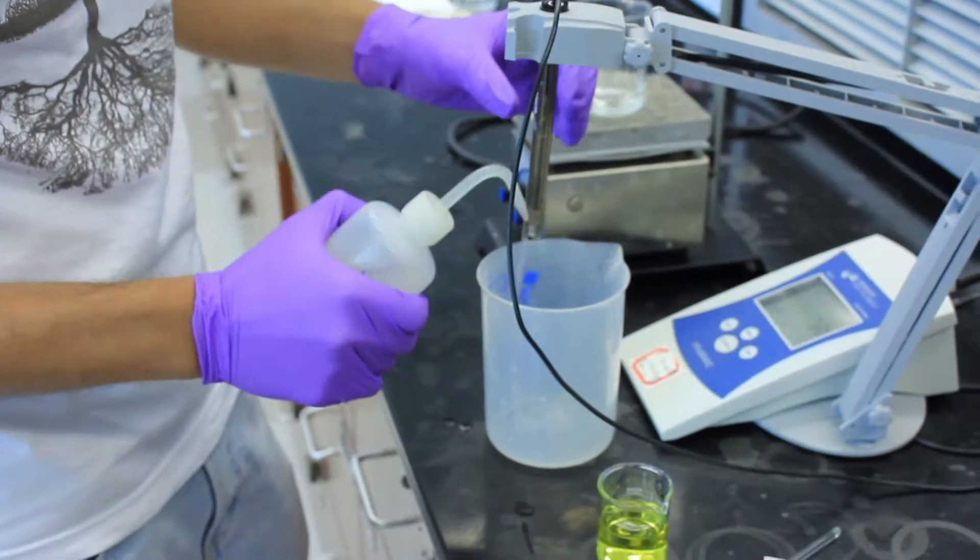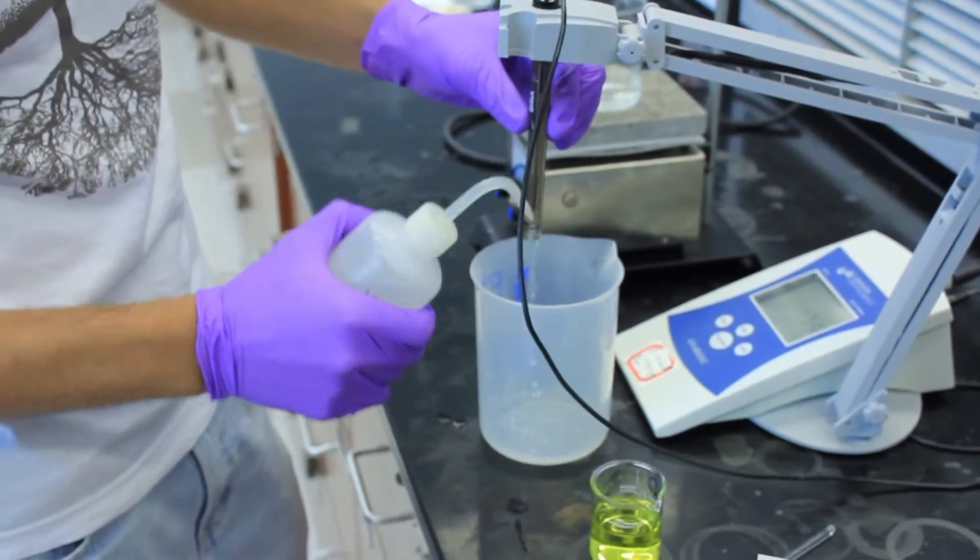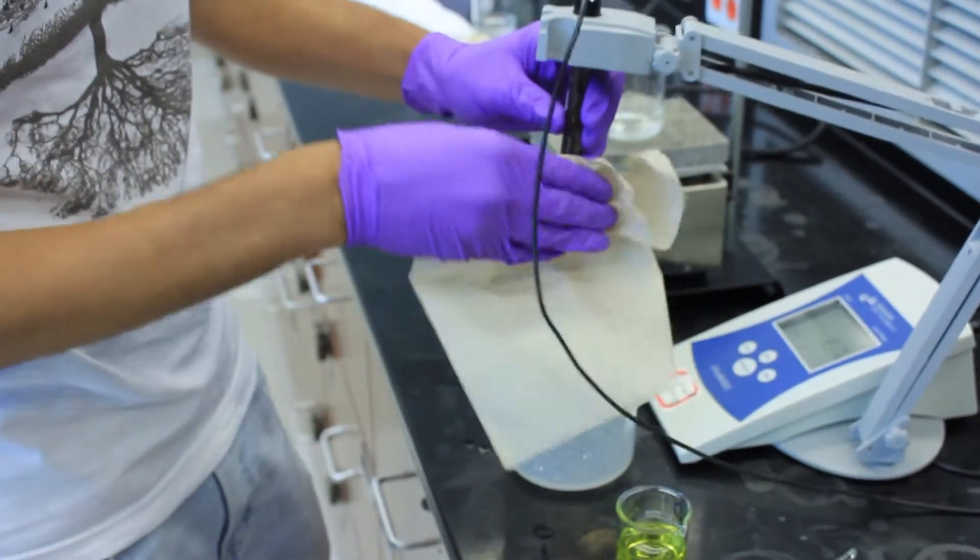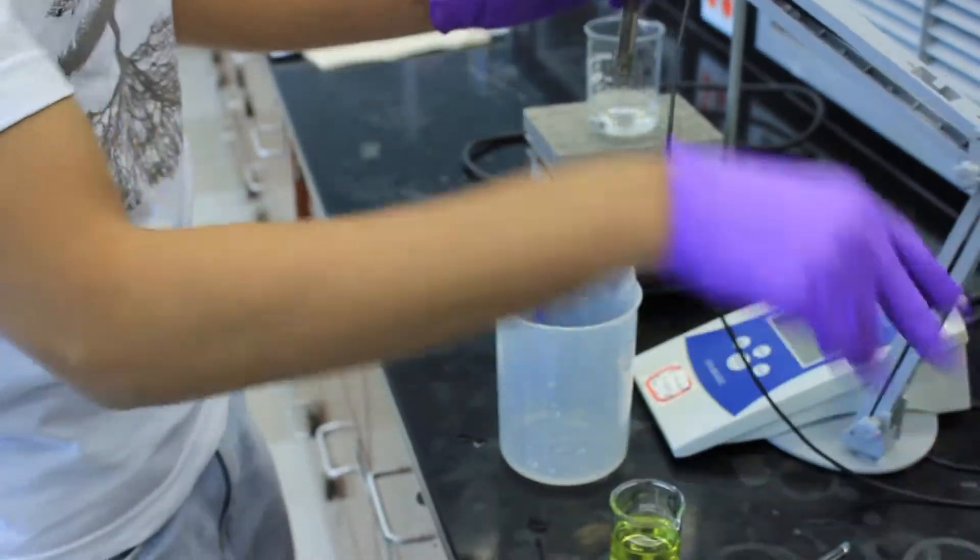Be very careful because the glass electrode is very fragile and can break easily. Rinse it off and then dry completely before inserting it into the HNO3.